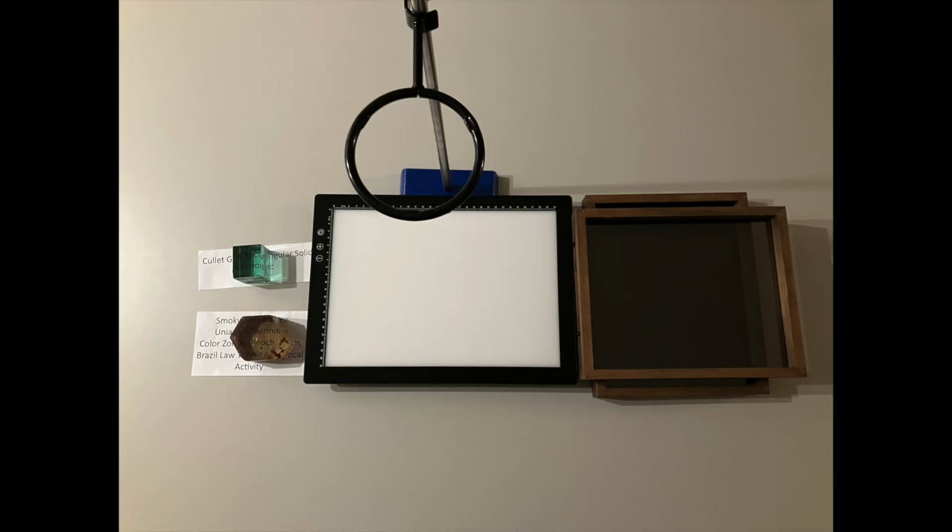Here's the experimental setup for our quartz versus glass demonstration. We've got our samples of quartz and cullet glass. There is an LED light board, which is the diffuse light source for our polariscope, and then we have two pieces of linear polarizer that in this case are framed just to make them a bit easier to handle. What is usually absent from my in-person demonstrations is the ring stand, and that's just here to hold the camera so that we get a nice view of what's going on with our polariscope.